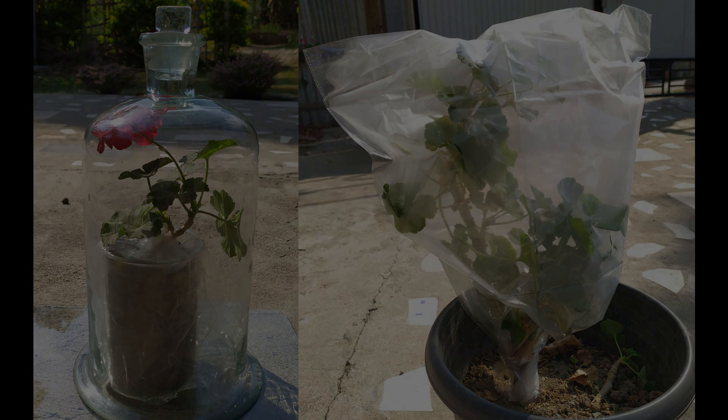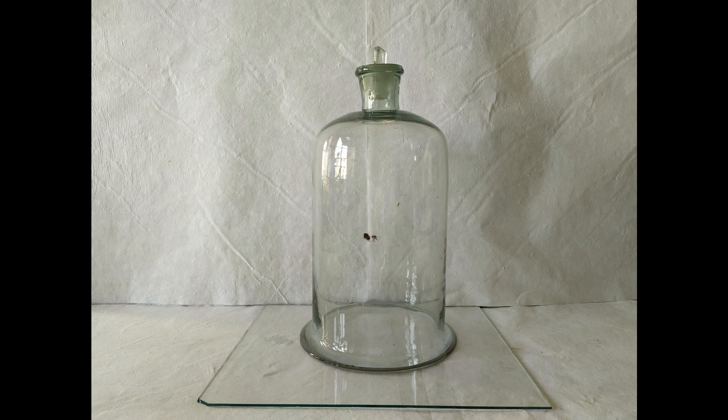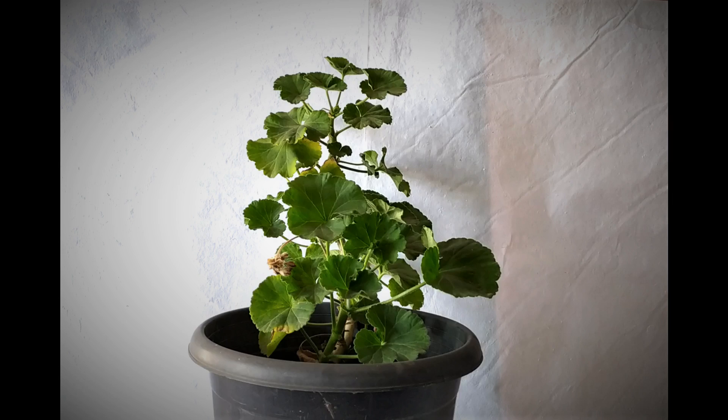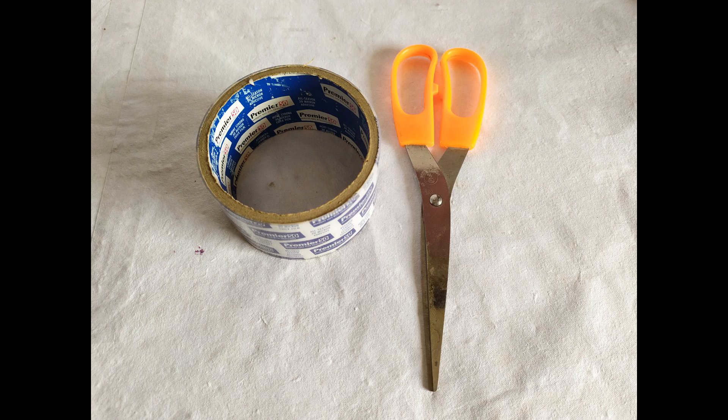For this experiment, we're going to need the following: a bell jar and a glass plate or a large transparent plastic bag, a potted plant, sticky tape, and scissors. Let's begin.